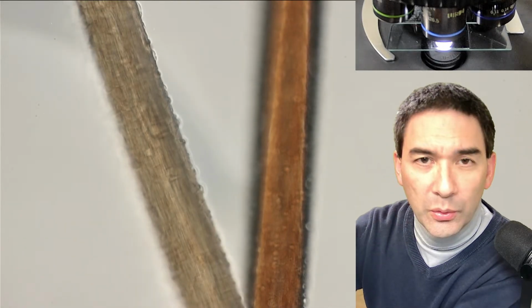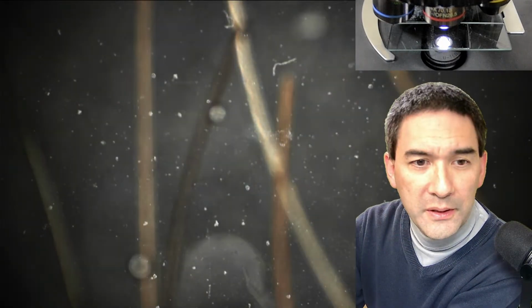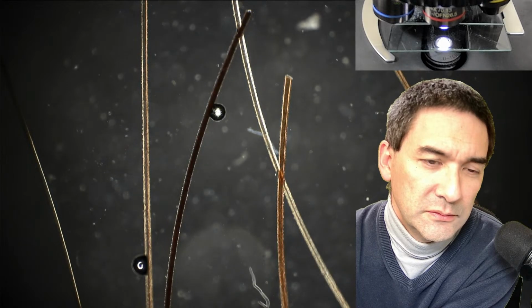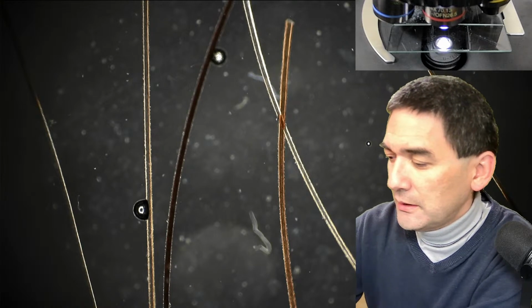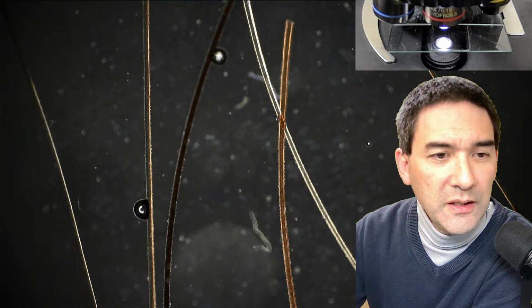The only thing is I do have dark field, but only with the low power 4 times objective. Okay, so I can do that. So let's flip this one in here. Okay, I have to open it, and this here would be now dark field. I have to also refocus again here. Unfortunately, I don't have dark field with higher magnification. Closing the field diaphragm is also not the way to go.